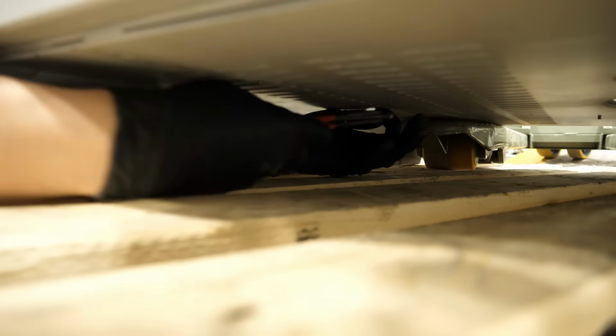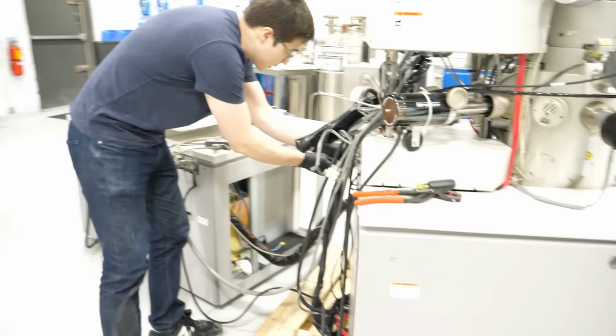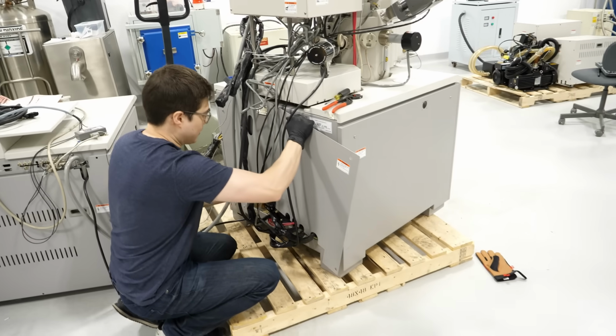Of course this one's stuck. Yeah, it's stuck because we hit it with the pallet. So we probably bent it a bit. Maybe when they were lifting it, they bent it. Okay, we got this. I'll take the back off. You want to film it? Yeah. If I undo the panel here, let's see what the insides are like.